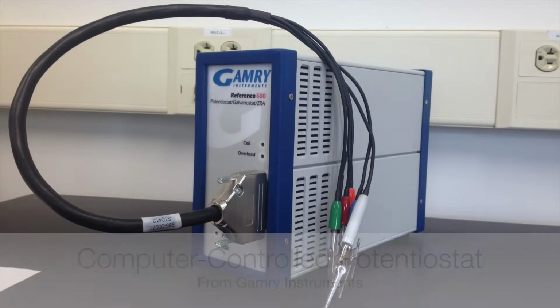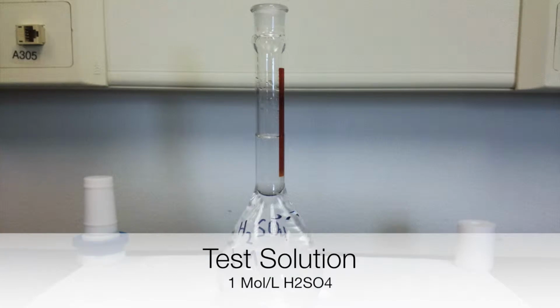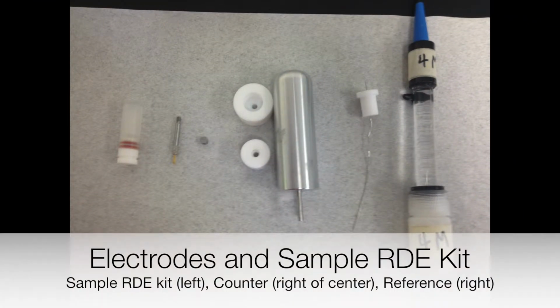Equipment and materials. A computer-controlled potentiostat for performing the electrochemical techniques. Test solution. An aerated 1 mole per liter sulfuric acid solution to simulate a corrosive environment. In this lab, 3 electrodes will be used. The first electrode is a steel RDE working electrode that will be made using a sample RDE kit. The second electrode to be used is a platinum counter electrode. And the third electrode is a silver chloride reference electrode.